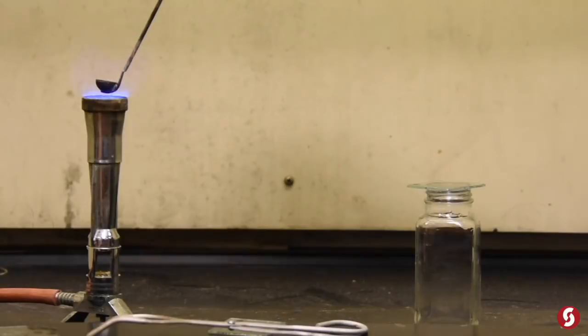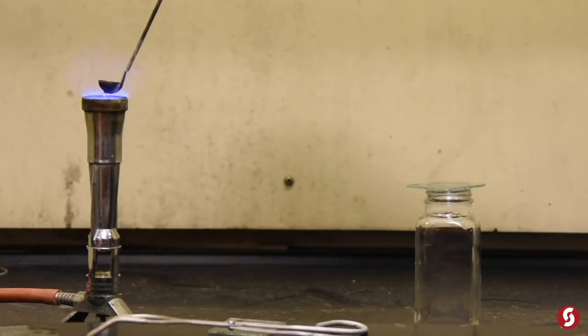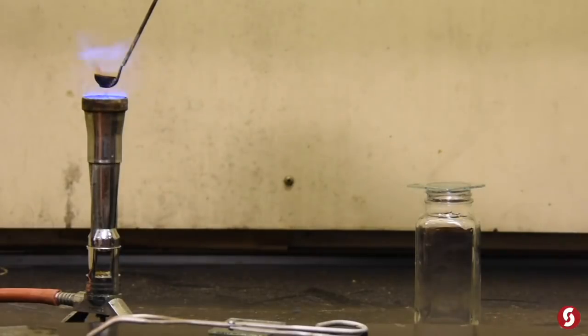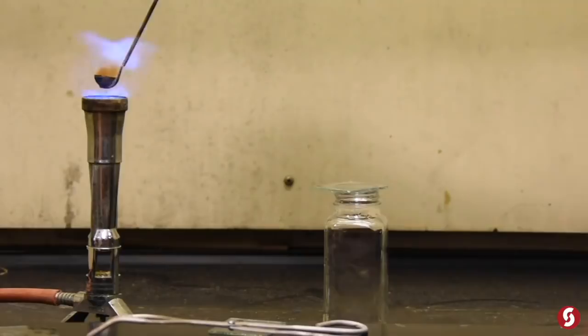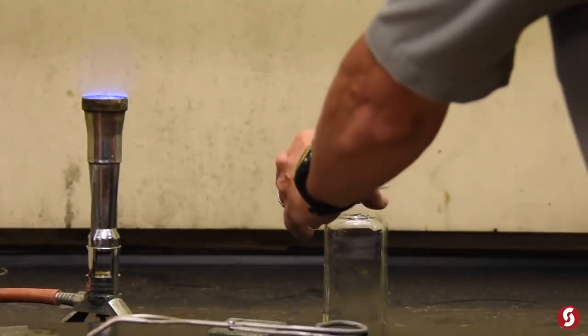Because when you burn sulfur, it smells so bad. And actually you can taste it. That's what happens. Now first it will liquefy, and then it will actually start burning with a purplish flame. And you might be able to see a little bit of that bluer flame coming off. But it's a different ball game when it goes in here.